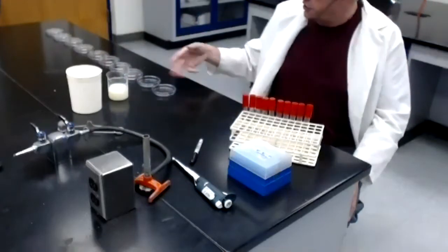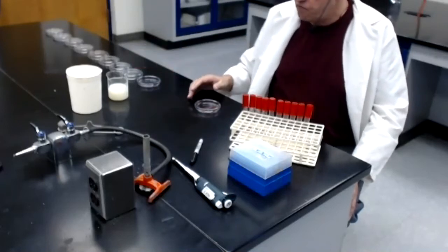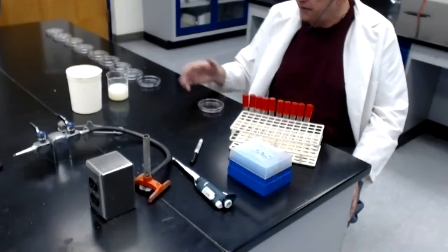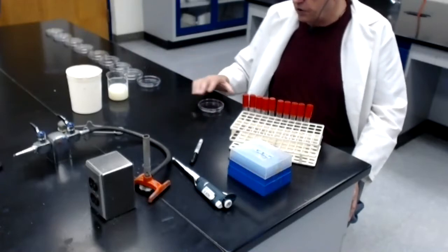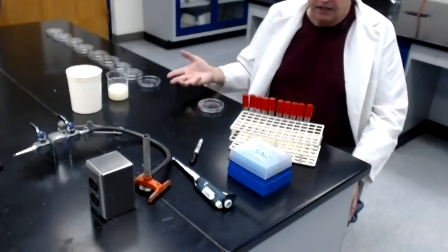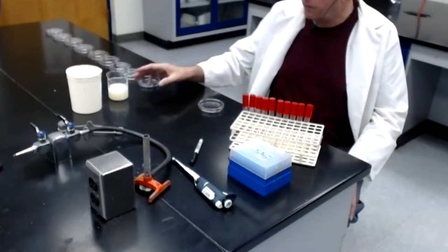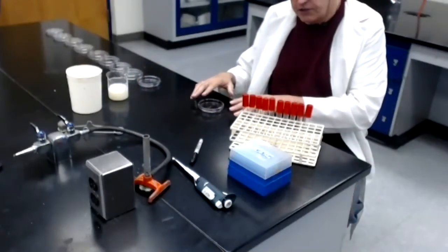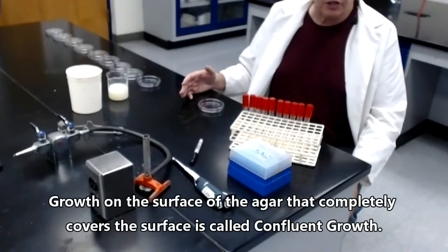Well, you might think, why not just spread them out on the surface of agar? Take a milliliter of milk, get yourself a tryptic soy agar plate that's sterile, but has the agar in it, of course, and then just dispense a mil of the milk onto the surface and then spread that over the surface of the agar. Well, you can do that. Technically, it's possible, but it won't help you because there are probably so many bacteria in 1 mil of this milk that they would all grow together on the surface, and you would find that the surface of the agar would be completely covered by bacterial growth.